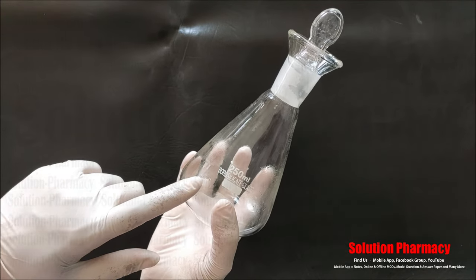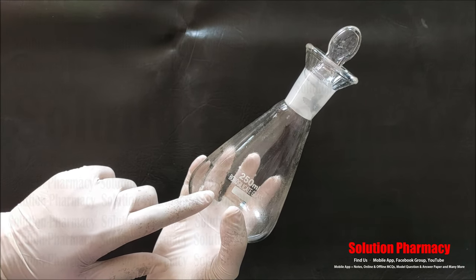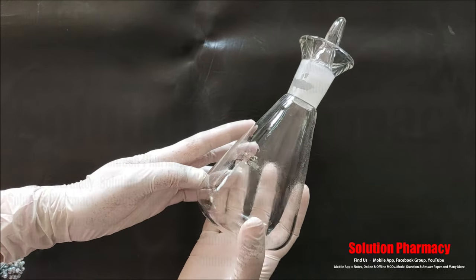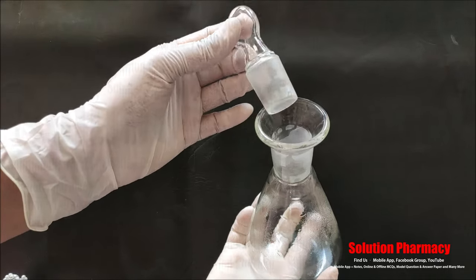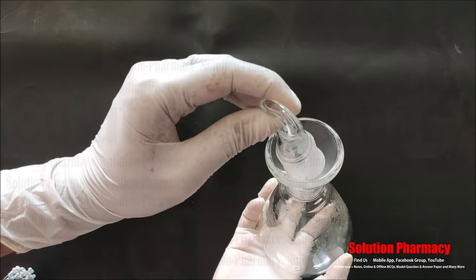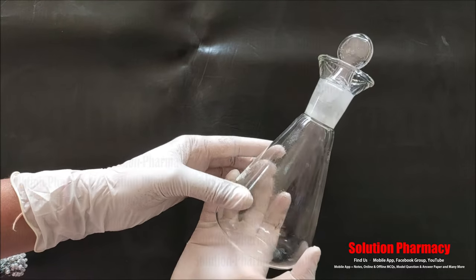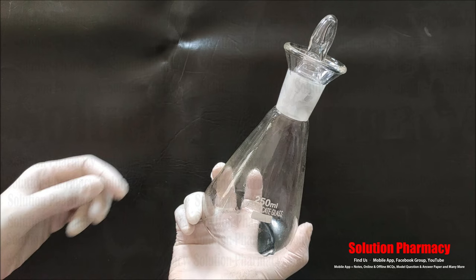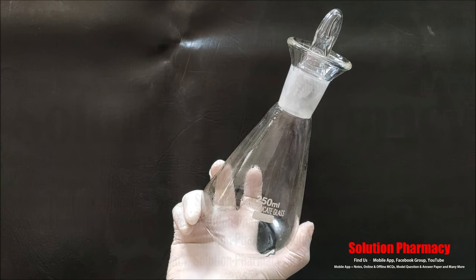Next you can see this glassware — it is called an iodine flask. This is a 250 ml iodine flask, also made of borosilicate glass. You can see its cone shape with a flat bottom and a funnel-shaped top. It has a stopper that fits the joint properly so that iodine vapour does not escape. We use it for the determination of total iodine values, such as iodine values in fatty acids and oils, and for other analytical purposes.